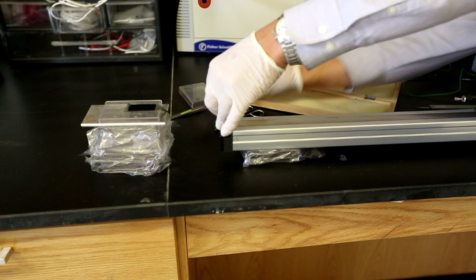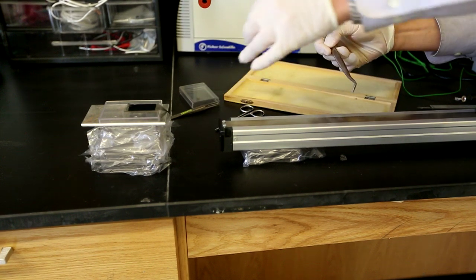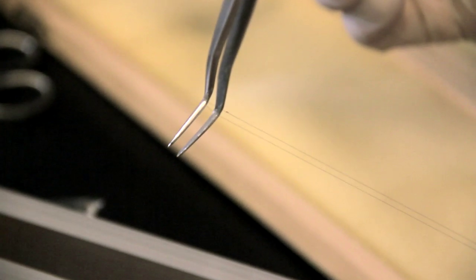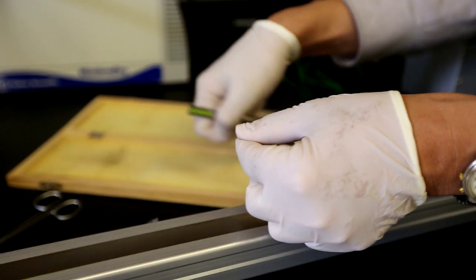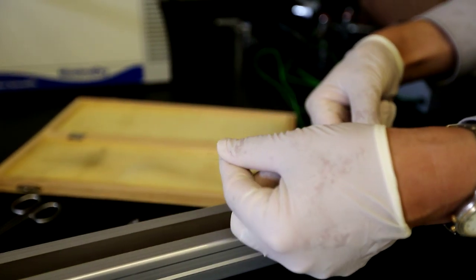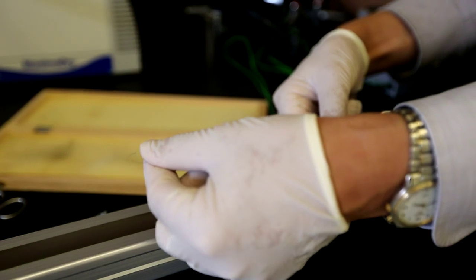Right now, to make it a little bit more stable, he has to keep winding it up even tighter. So now he's actually broken the connection from the forest of carbon nanotubes. We're not spinning any new carbon nanotubes, but we're making the thread or the fiber even tighter. And then you can see it's a little bit easier to work with with more tension.